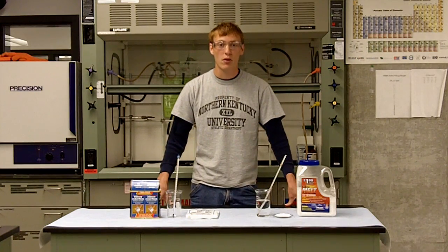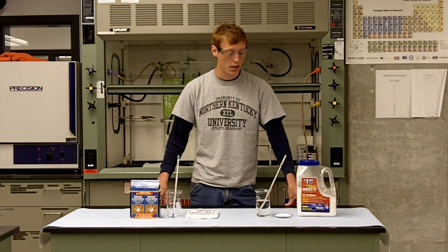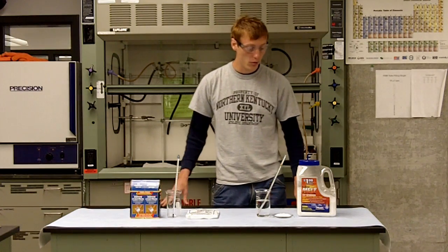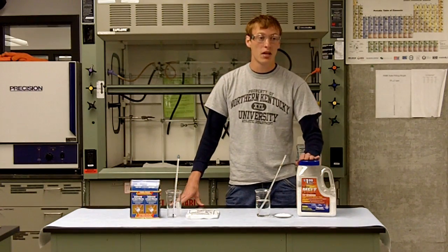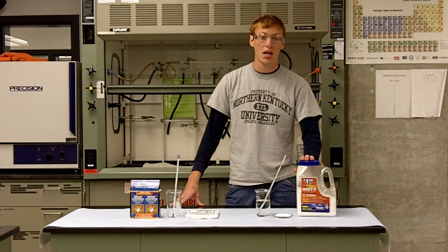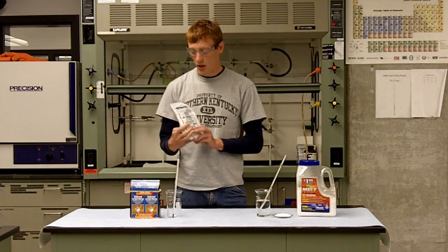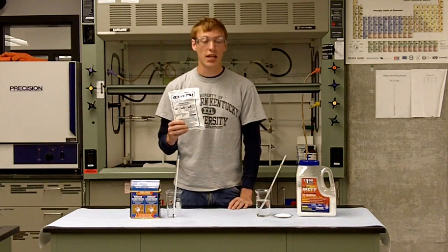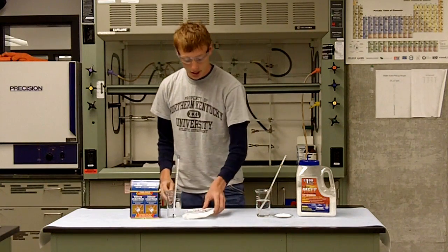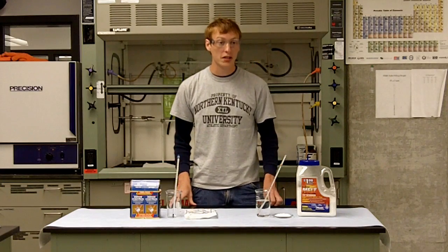Hi, my name is Bobby and today we're going to demonstrate solution formation and the temperature change based on that. We have calcium chloride here, which is found in most ice melters, and a commercial ice pack which contains ammonium nitrate. We're going to put both of these in water and see what happens.